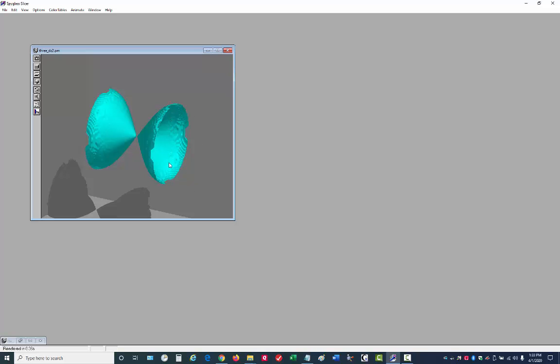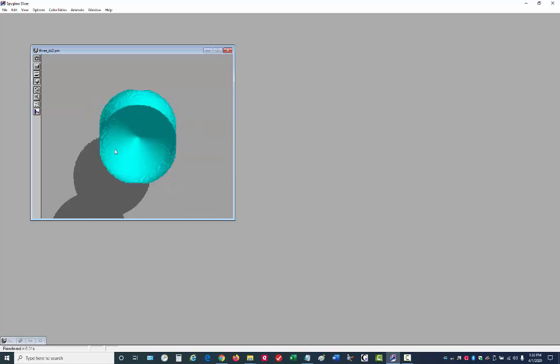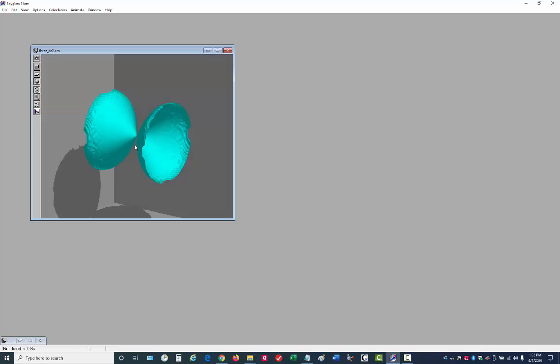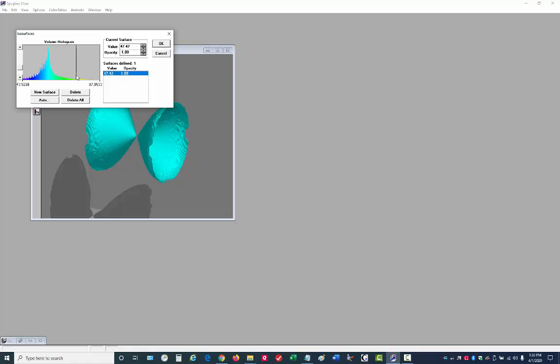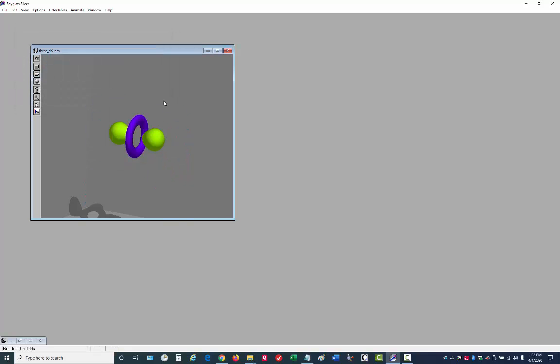So you've chosen a value here. If your renderings look like this, you've chosen a value that's inappropriate for your data set. You need a much bigger box to show the orbital with that ISO value because it's chopping it off at the edge. So we can go back and adjust that, make it a much larger value. And also, let's do both positive and negative values. So you can see your rendering looks quite different if you choose an isosurface that's contained within the box, and if you choose both positive and negative values for your isosurface. This looks a lot more like a d orbital.